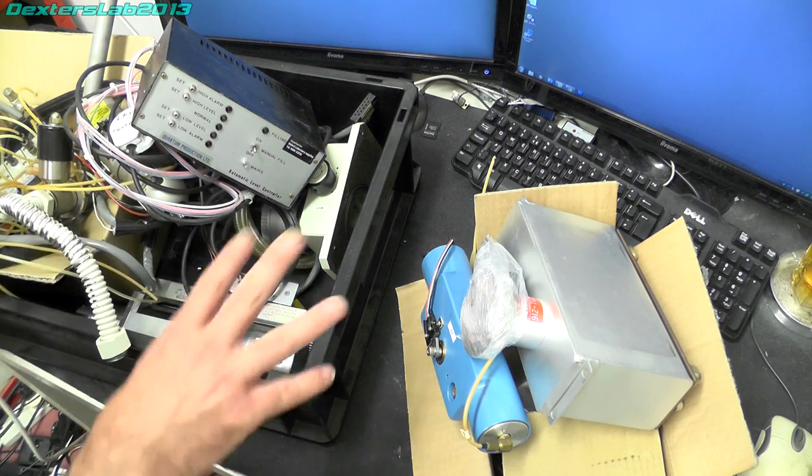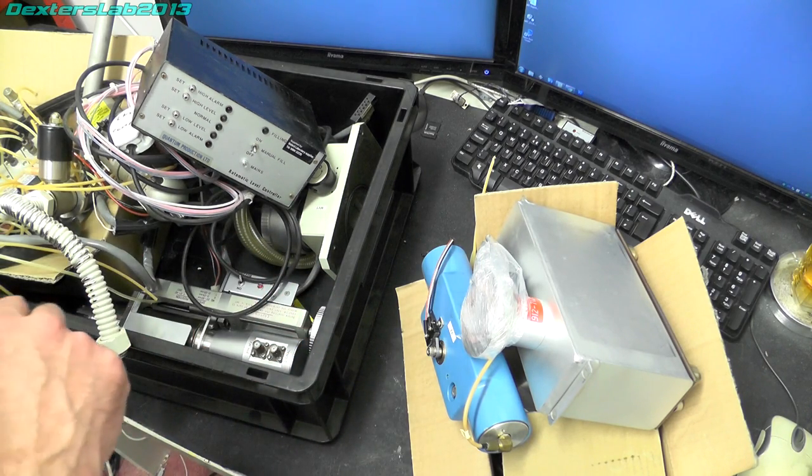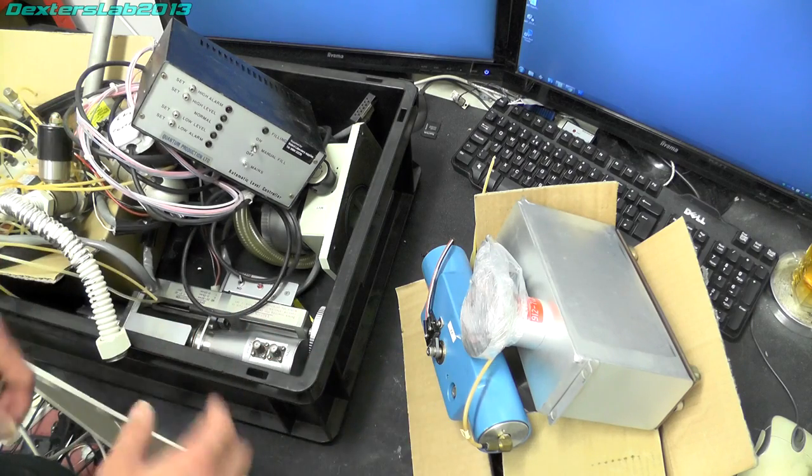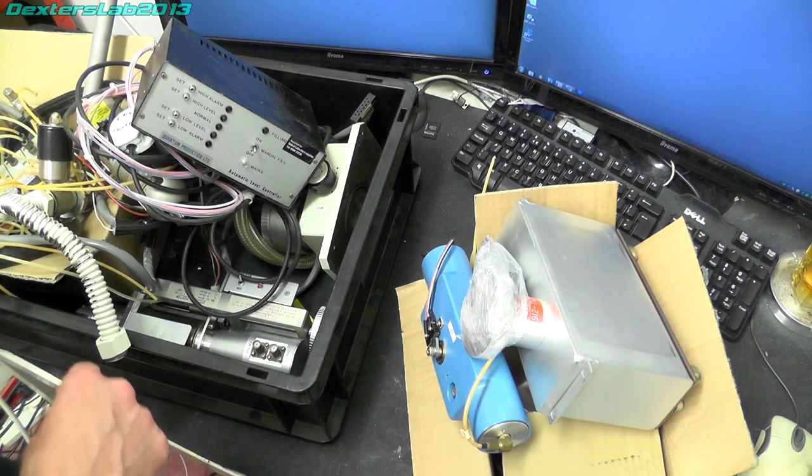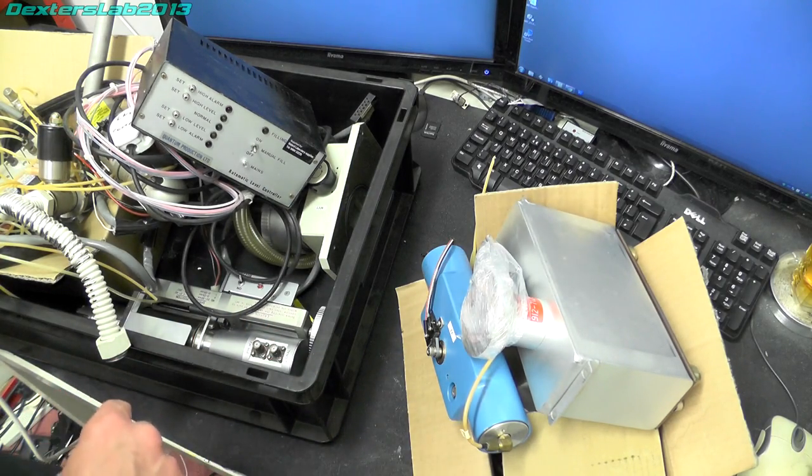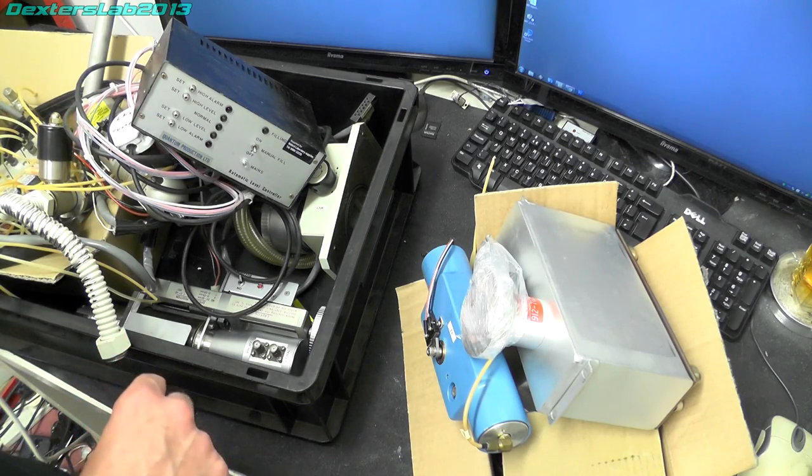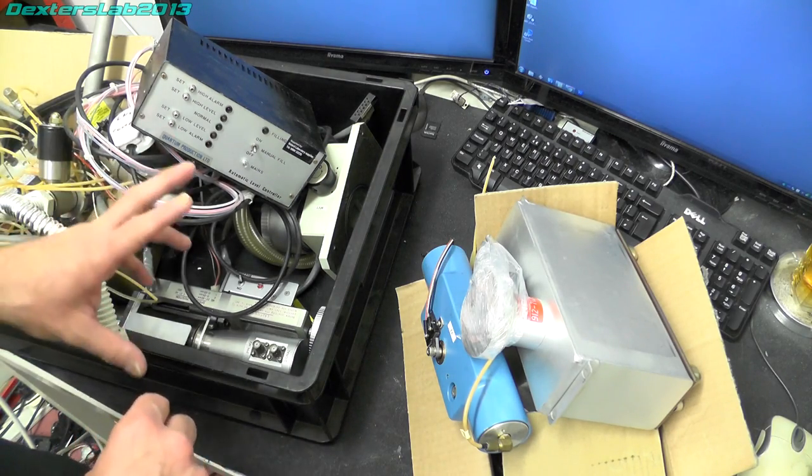So some of these bits will be heading off to their new owners pretty soon. I thought we'd just run through the bits that I've got and I'll tell you why they've been kept and make any corrections about what they actually are as well.